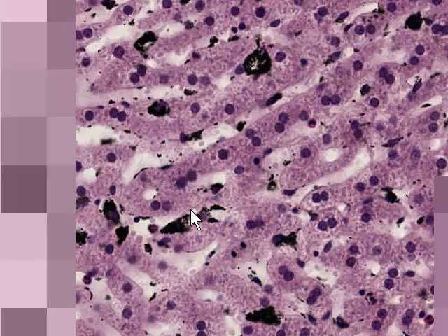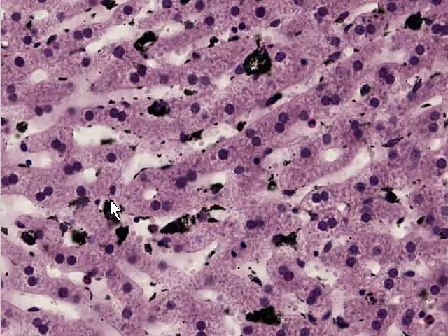And here we can see carbon particles accumulated in a cell, which, as we can see quite clearly here, is actually in the sinusoid, not in the hepatocytes. Here again, a cell in a sinusoid, in a sinusoid, in a sinusoid, and these are the Kupffer cells, the tissue-resident macrophages that are found in the sinusoids of the liver, and which play very important roles both in heme metabolism, in iron metabolism, and in secreting inflammatory cytokines in times of liver damage, which in turn stimulates other cells to secrete connective tissue and can cause cirrhosis.